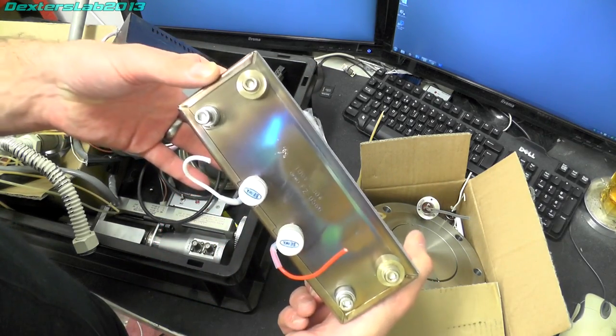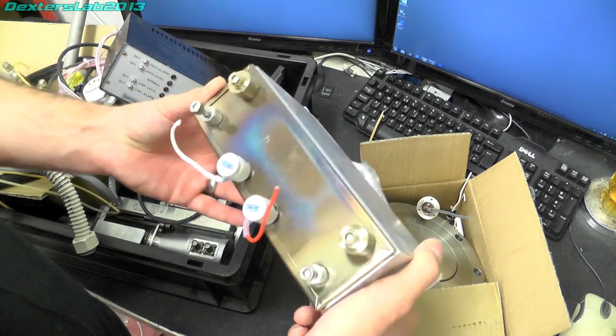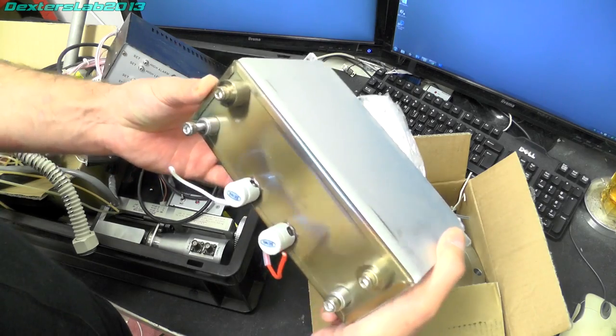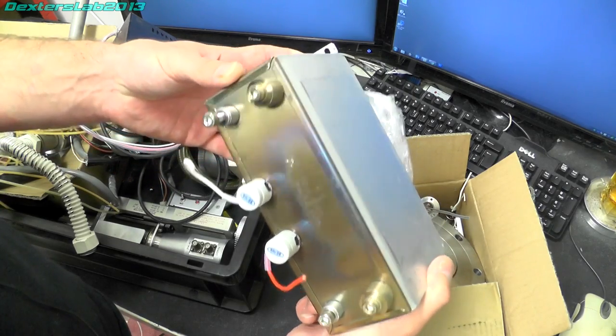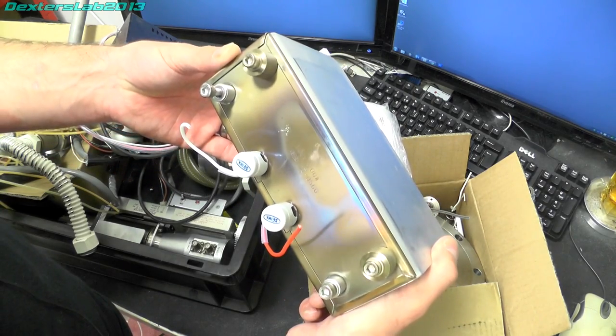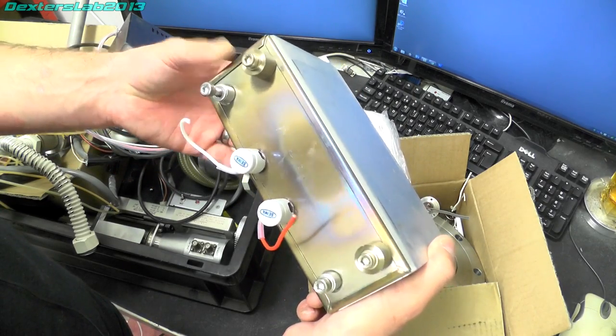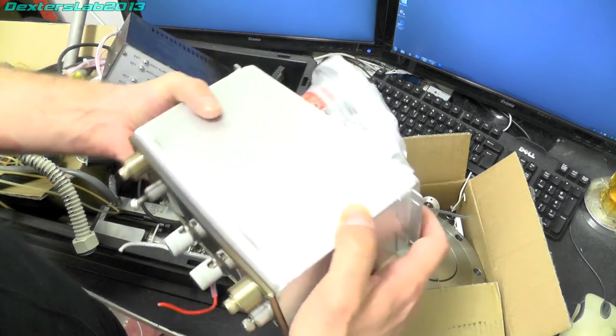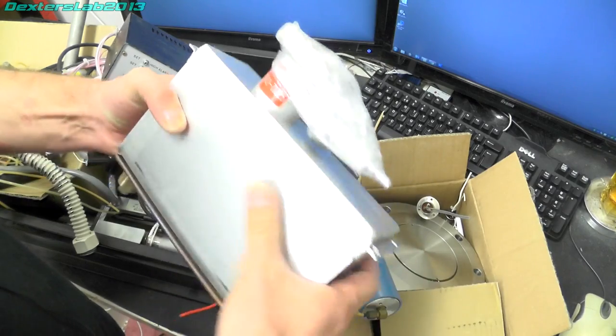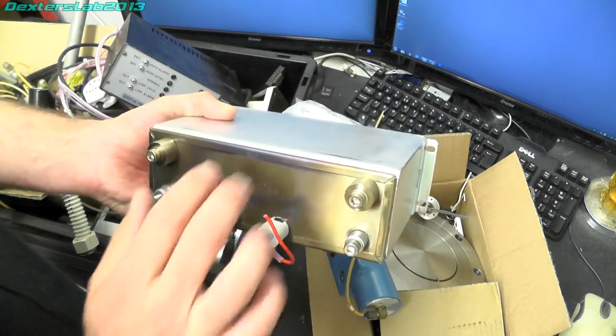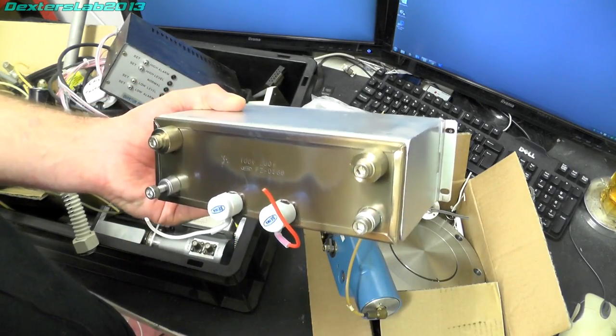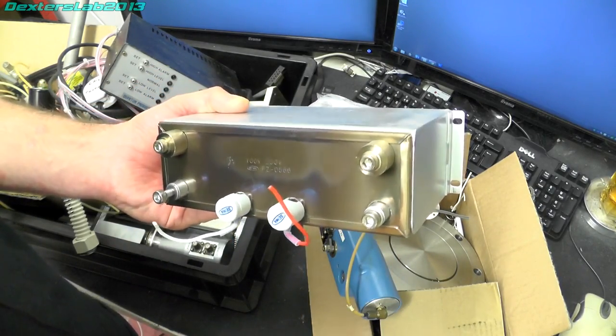On the back there we've just got one of the heating baking plates that runs off 100 volts and that's 200 watts. So that's part of the baking out system.